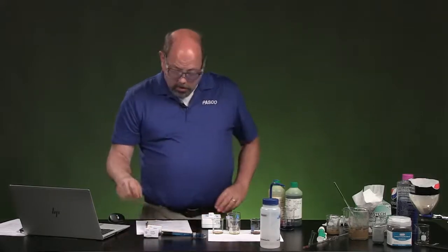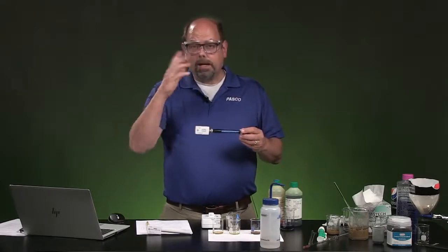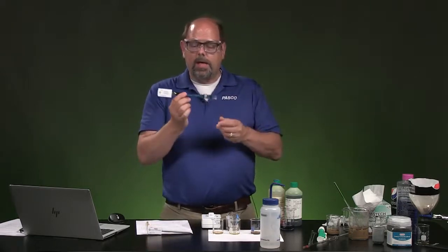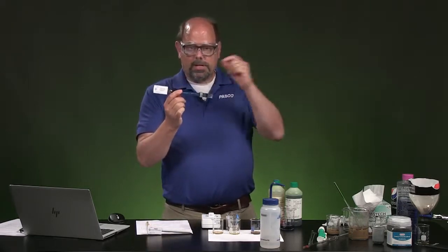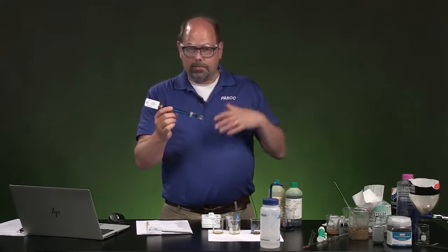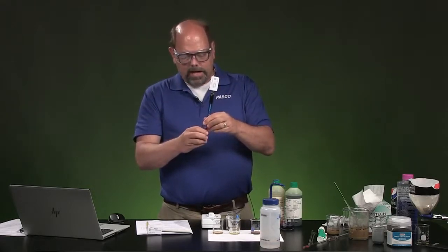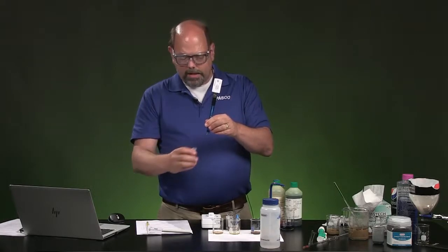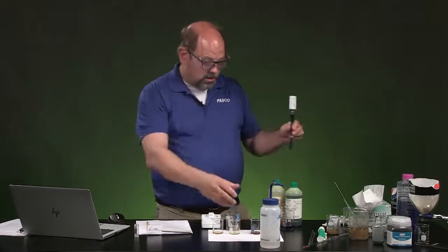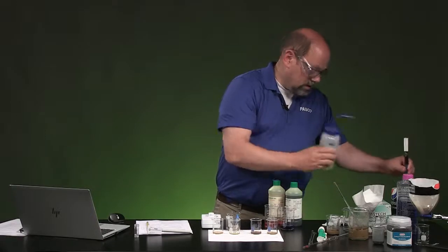Okay, now we're going to use the pH sensor. If something is dissolved and it's ionic, for instance, it breaks into two ions, pluses and minuses, and that will be detected by the conductivity sensor. Now, the pH sensor is going to look at each of those ions, and if one of those ions is an acid, an H, or if it's missing and it's got hydroxide, OH, then we're going to be able to sense it with the pH sensor. If they are not acid, nor are they base, they'll have a pH of around 7. If it's more acidic, it's going to have lower numbers of pH. I'm going to rinse this off real quick to make sure we get a good start without adding more to our substances.